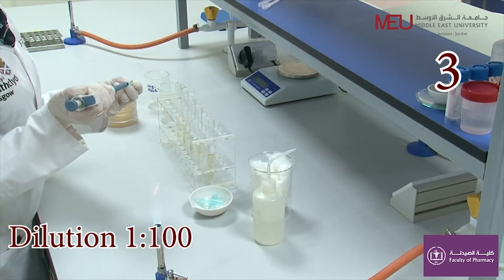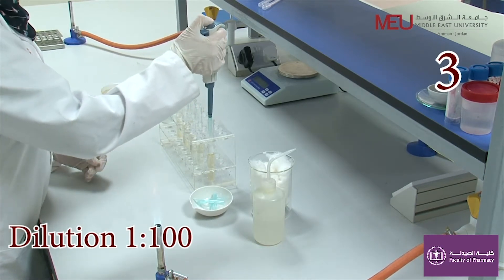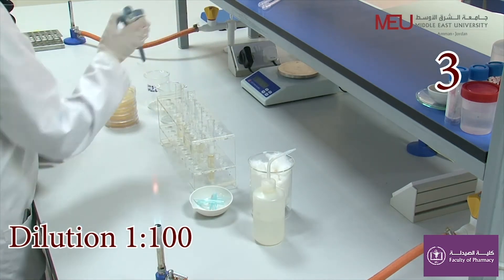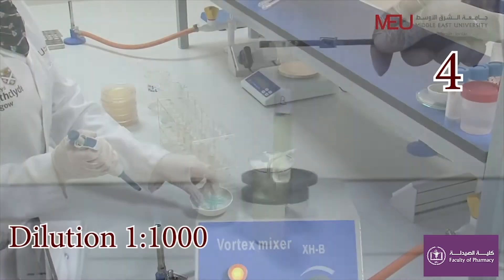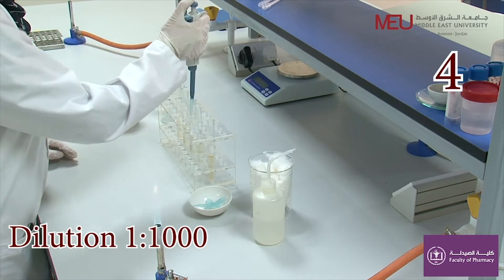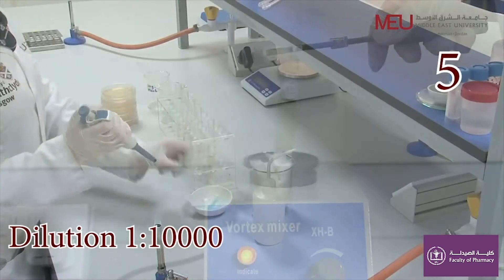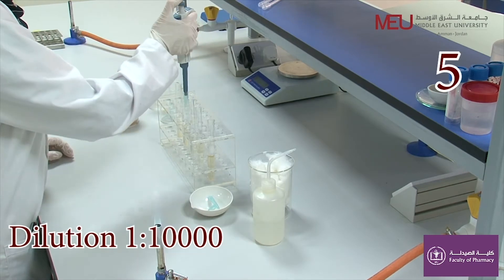Transfer aseptically exactly 1 ml from the first test tube to the second using a new pipette tip. Then transfer exactly 1 ml from the second test tube to the third, and repeat for the fourth and the fifth test tube.